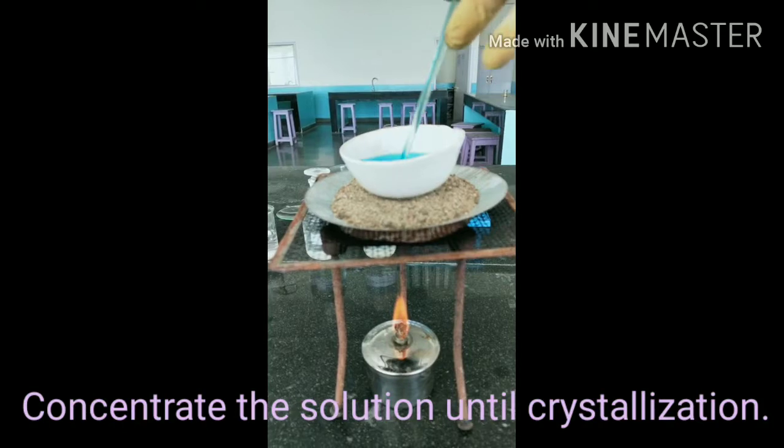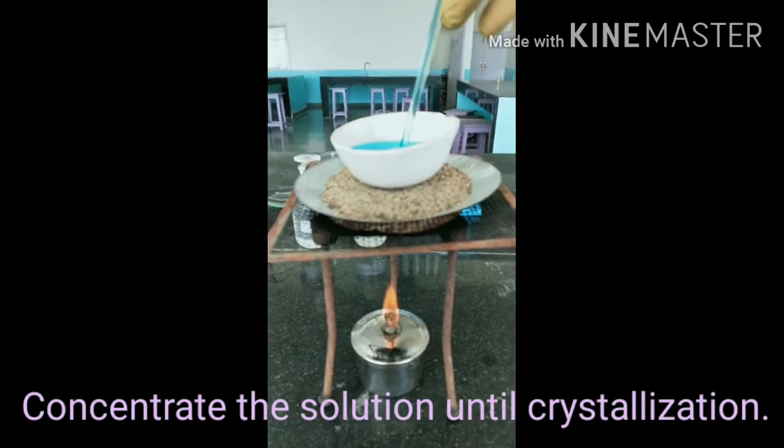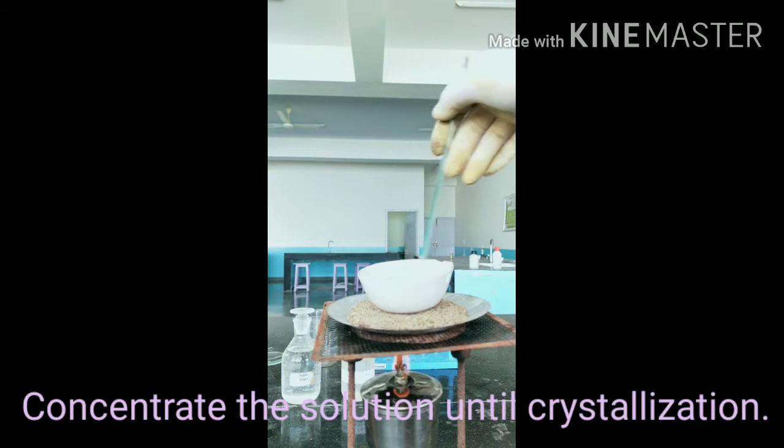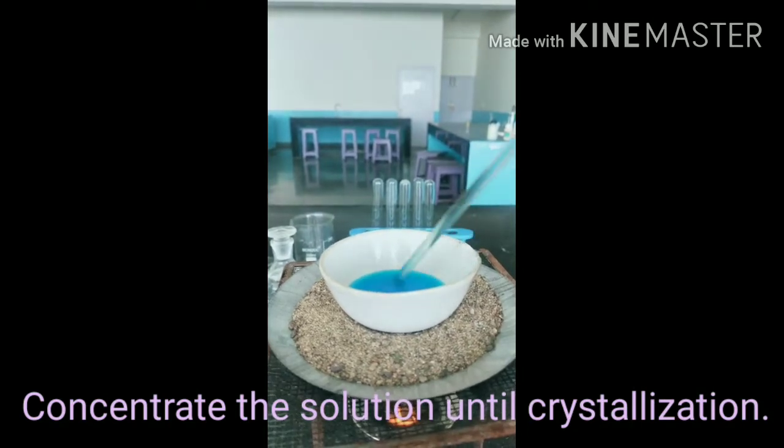The solution of copper sulphate is kept on stirring in between. The heating is done for the concentration of the solution. We should keep on stirring the solution regularly.